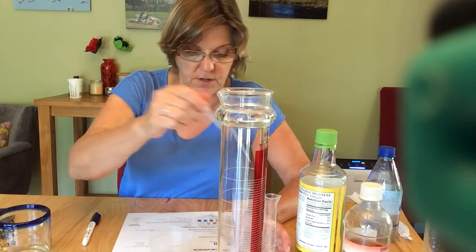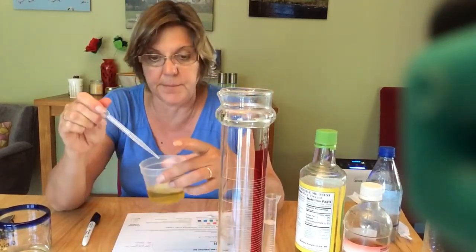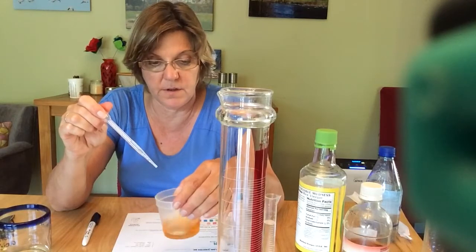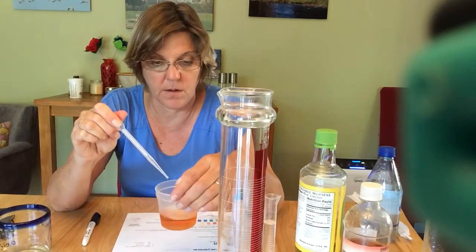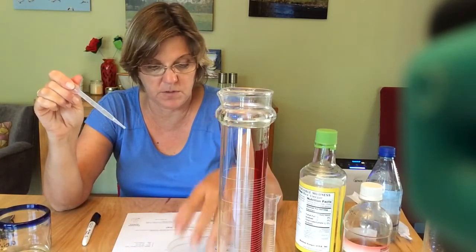Now the pH of vinegar, I think, is 4.5, so you're not going to get lower than that, but I think I should be able to get to 5. Good, 5. That's pretty good.